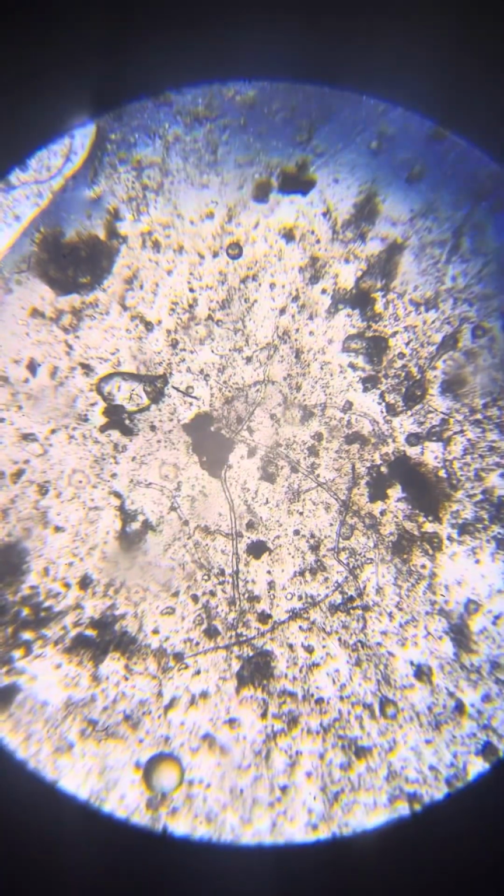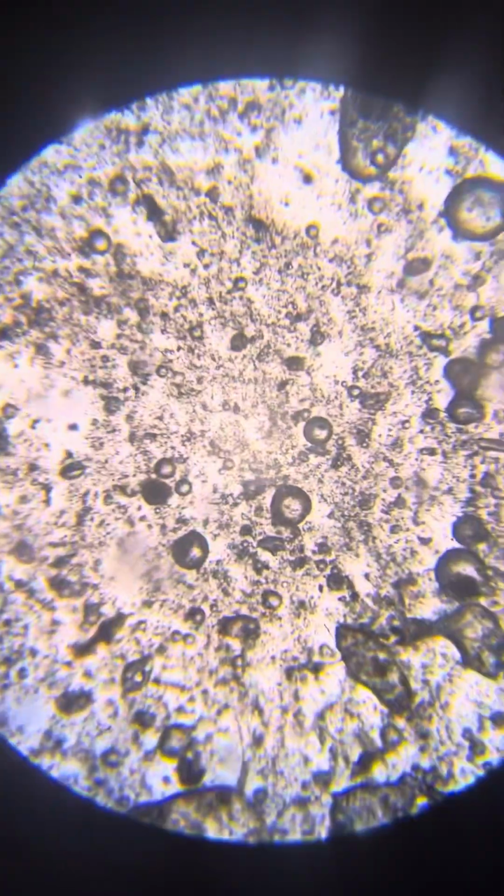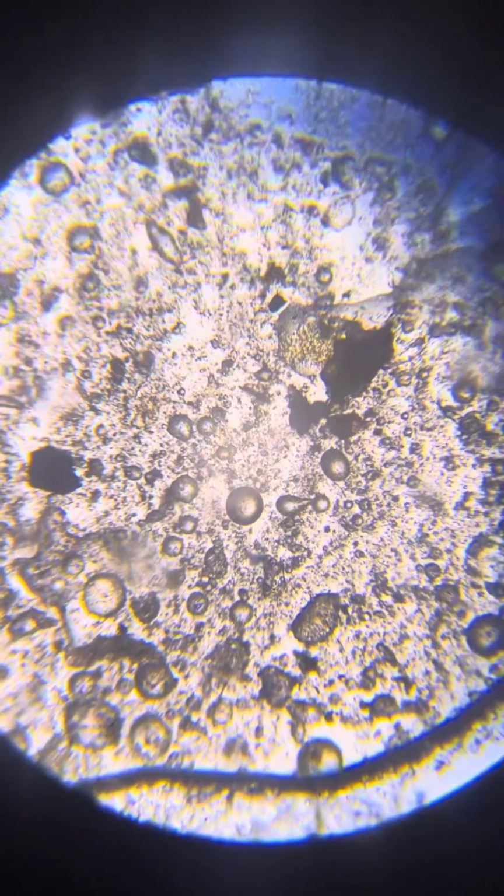So nice. I mean, it's not groundbreaking. Mostly we see Neos of all sorts of sizes, not huge ones. We will zoom in a second. We see many zombies like that, I mean, zombified life forms that were killed by the Neos and are now in the zombie state.